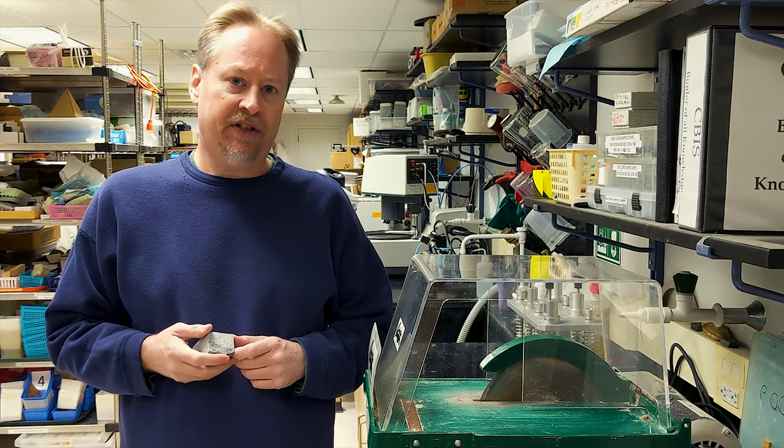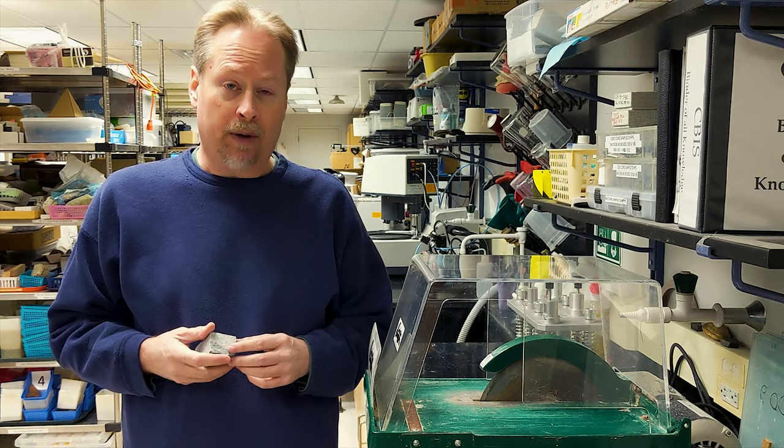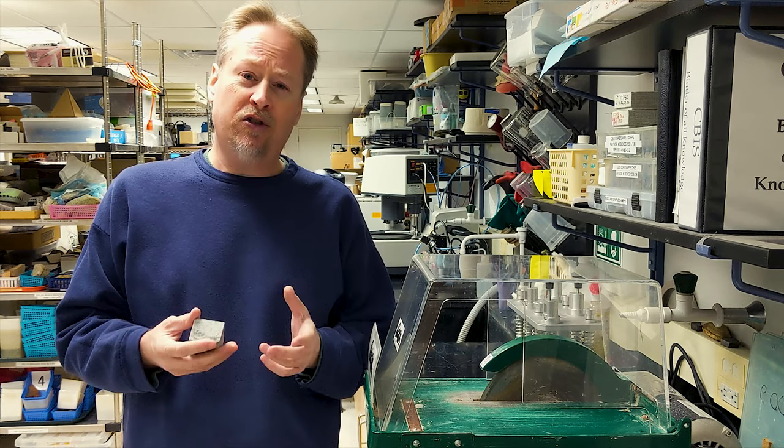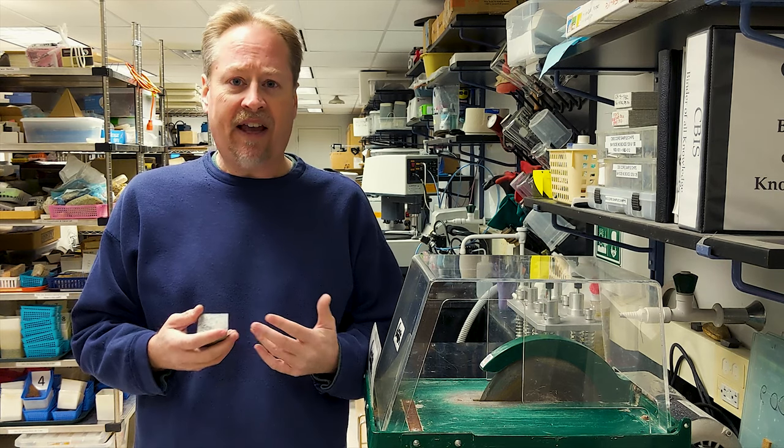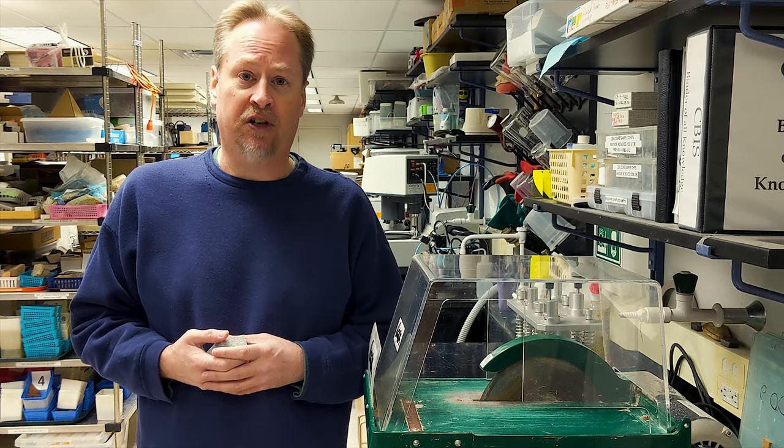Here in our lab, we use a 10-inch Covington trim saw, which is similar to other trim saws available on the market, but you should always check your documentation for your equipment to identify any unique features or special functions it may have.